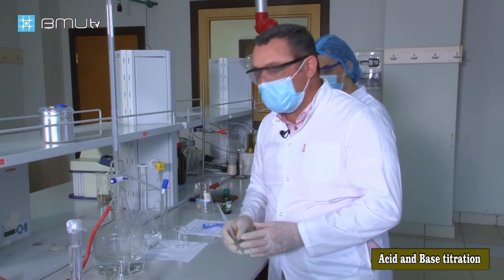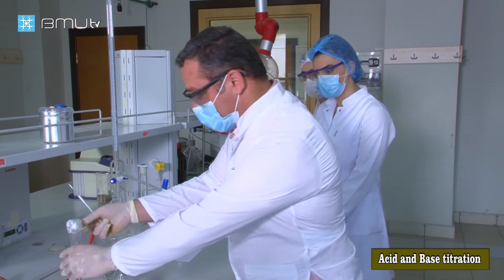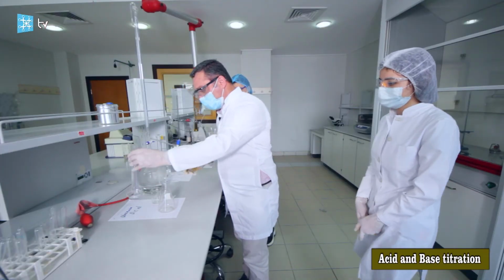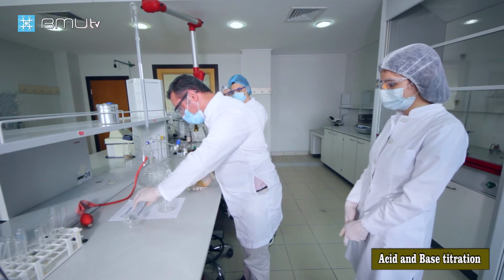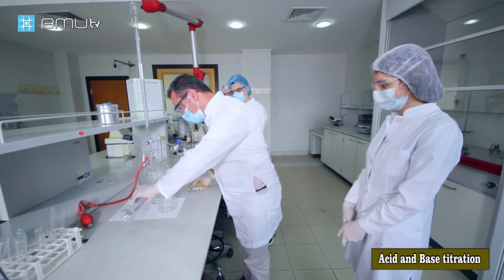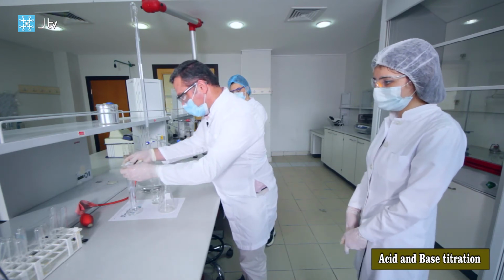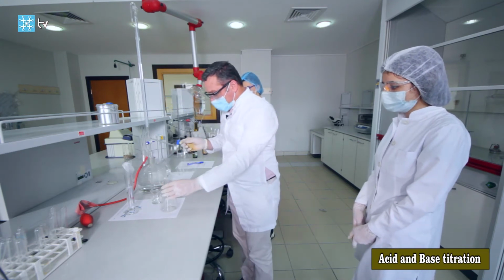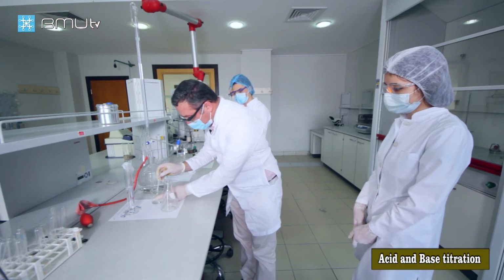Now we must take the unknown acid solution. This is our unknown acid solution in the graduated cylinder. We should pour it into the beaker. Now I want to take 3 milliliters of unknown acidic solution.